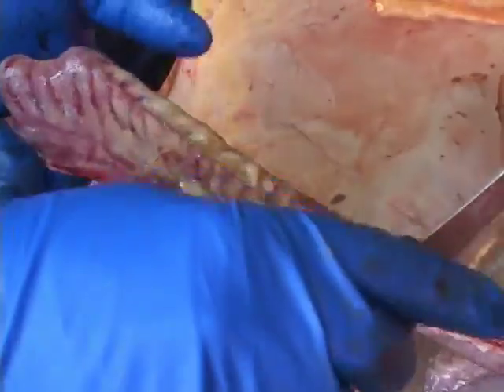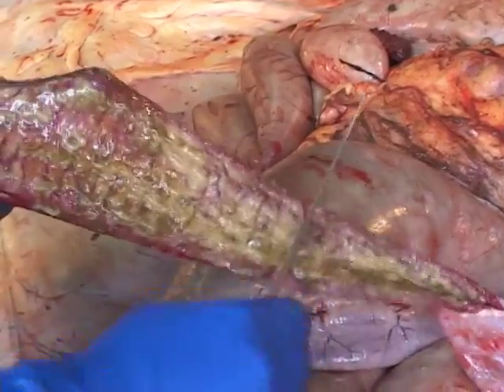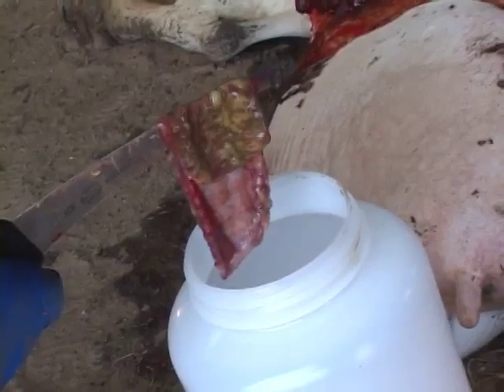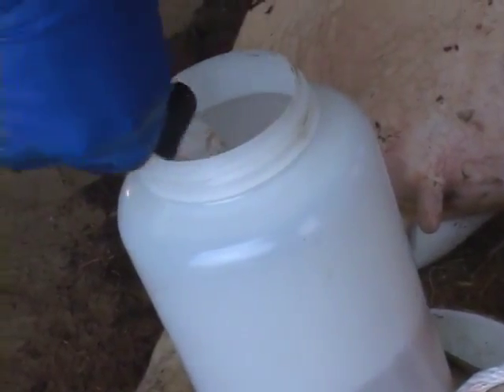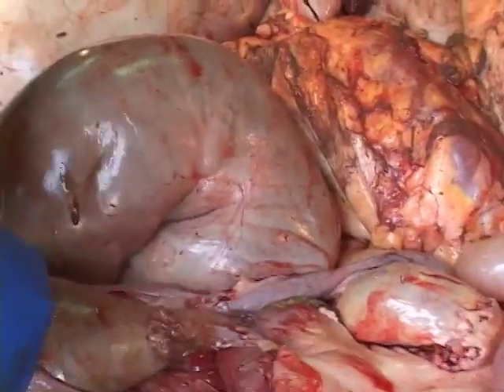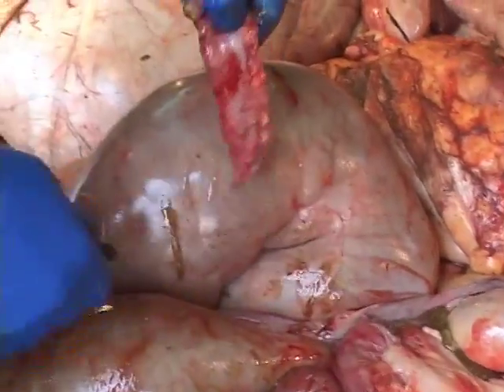Never scrape the bowel with your knife. Scraping the mucosa damages the surface and prevents proper histologic examination of the tissue. To collect a sample for histologic testing, you can simply trim off a section of the intestine and place it in the formalin jar, swirling it in the solution to ensure the formalin passes through the lumen. Alternatively, some people prefer to submit a loop of intestine that has not been opened along its mesenteric border.